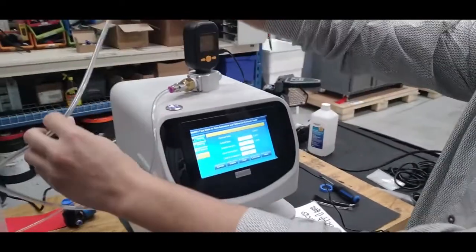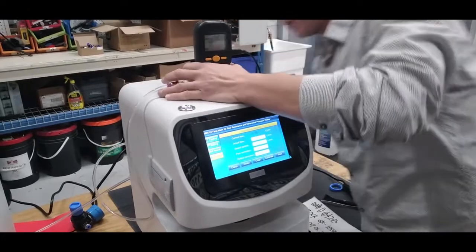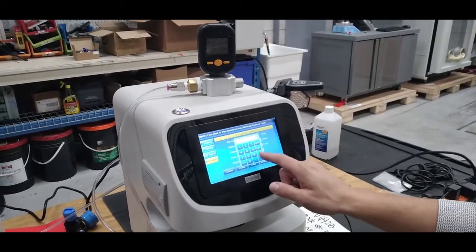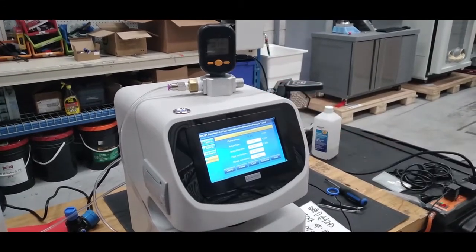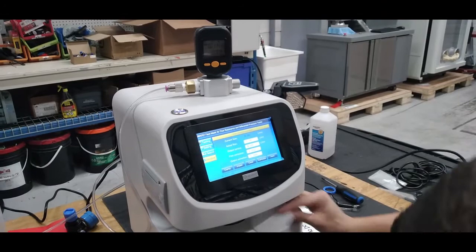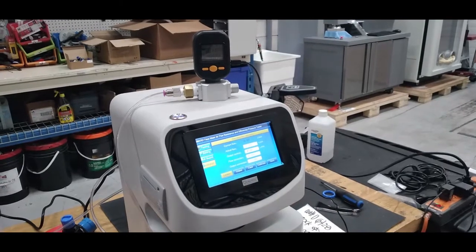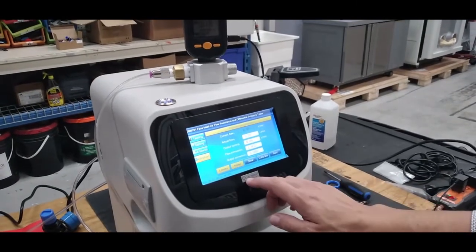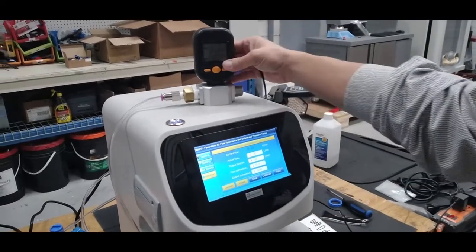This is a flow gauge — place the flow gauge and connect it in the back to the calibration port. Enter a flow of 8 first, using a blanking cap, either stainless steel or plastic. Set the flow to 8 and press intake to read the flow and match your gauge.